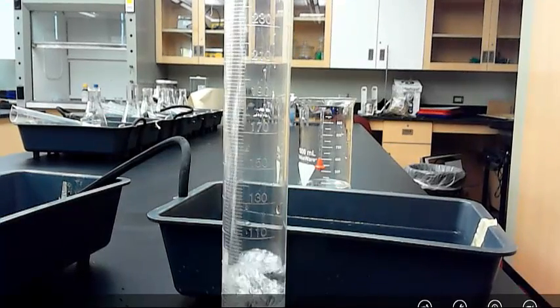From there, you'll have a graduated cylinder. So you'll do some measurements. I poured it everywhere. Don't care, you're not going to do that. This is a 250 milliliter graduated cylinder, and I still have way too much stuff. So I don't care. I can take a measurement of the level here, and I can dump that out. And then I can go ahead and pour the rest in. So you'll have some pieces of data. And so then I'll have two pieces of data. Great, I can take that measurement. That represents the water that was in the flask.